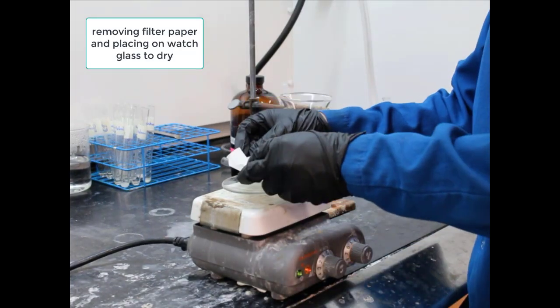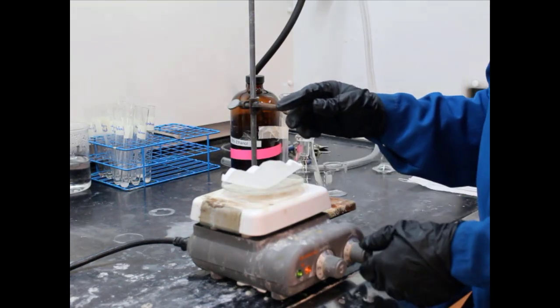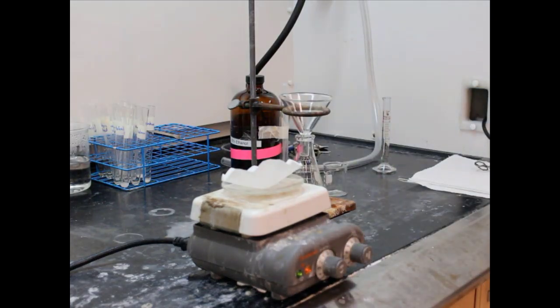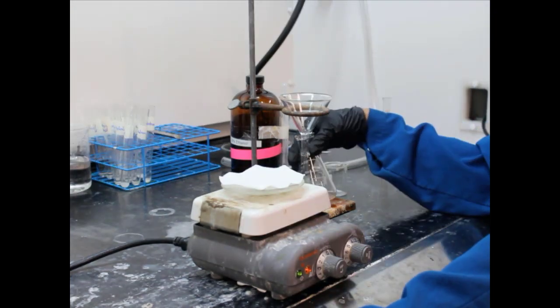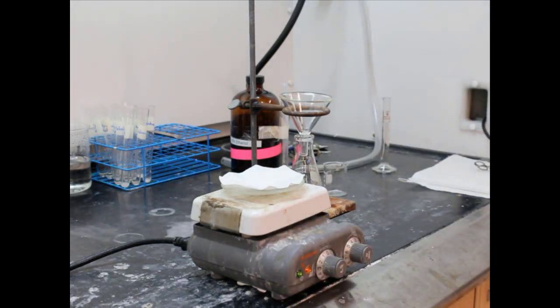All right, and so now they're going to allow the filter paper to dry. So they're putting it on a watch glass on a hot plate, and putting the paper on top of that. Whenever something like this happens, you do have to be careful not to burn the filter paper. A lot of times, the filter paper can burn while simultaneously you begin to melt your solid. So this is one of those things that you have to watch very closely.